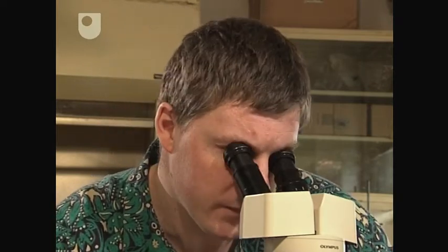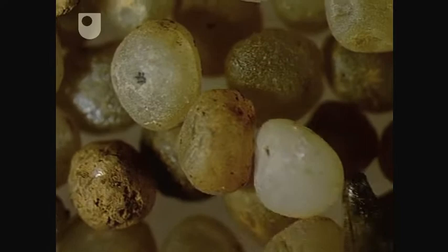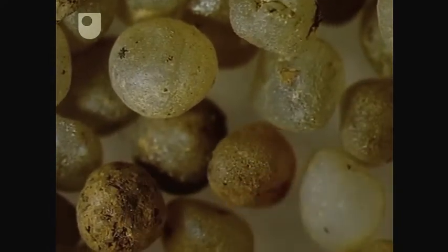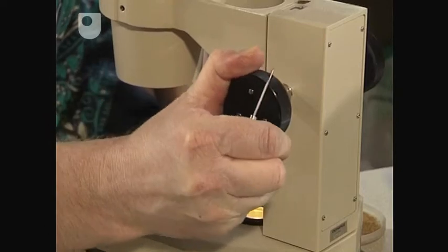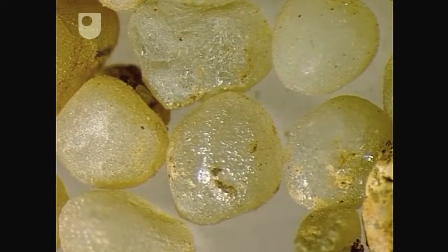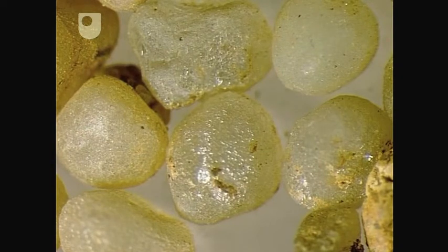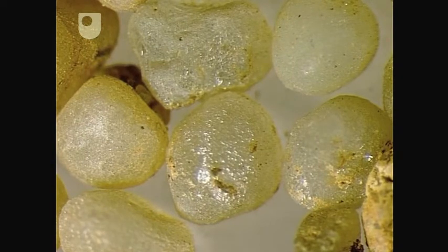Again, I'm very interested in the surface texture and the shape. Let's have a look at the shape first. It's really striking — these grains are beautifully rounded. There's hardly an angular surface to be seen anywhere. I have to think of some way in which I'm going to get very rounded grains with all the angular corners knocked off. But let's have a look at texture now. Look at this one here — you can see its surface is covered with tiny little pits and scratches. That's what's giving this grain its frosted appearance.